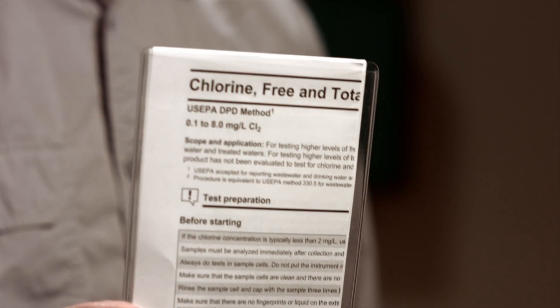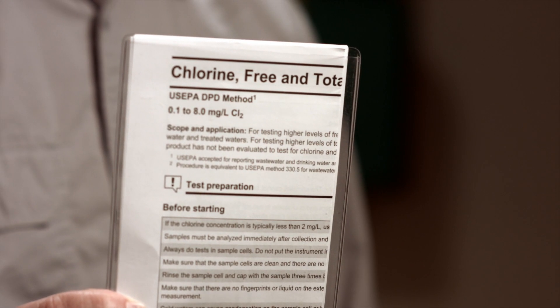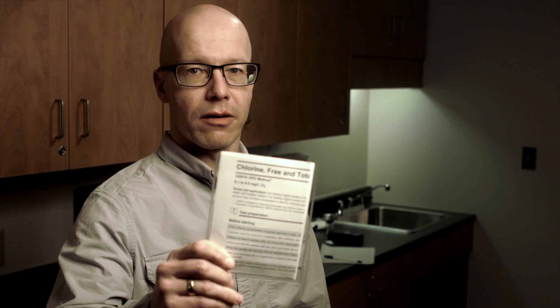The first test I will demonstrate is the free chlorine residual test in low range. Low range on this meter allows you to measure residuals in the range of 0.02 mg/L up to 2.2 mg/L. If your chlorine residuals are higher than 2.2 mg/L, you will need to switch your meter to the high range. Refer to your manual for instruction on how to switch your meter from the low range to the high range. You can also contact the operator trainer for your region for assistance.